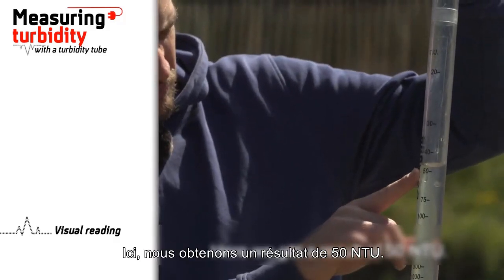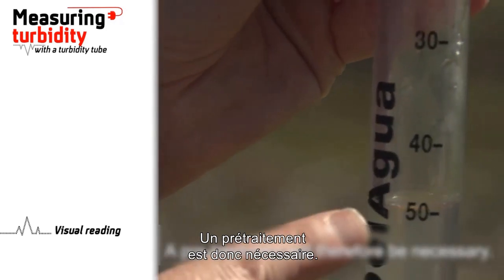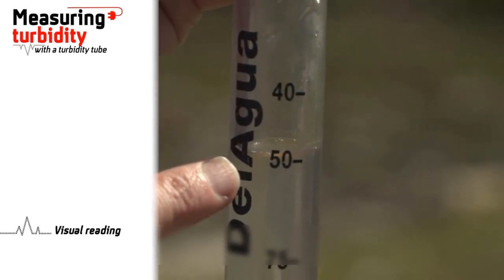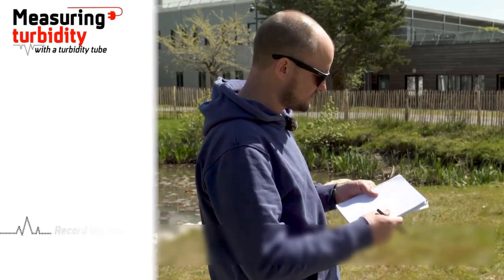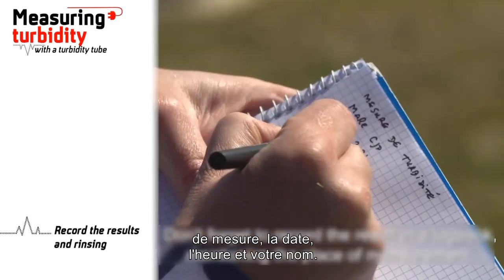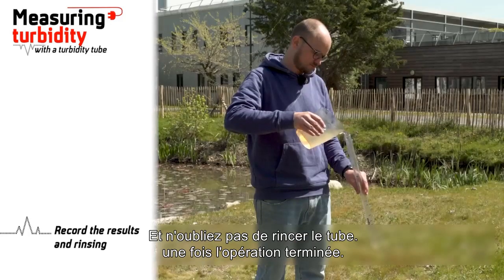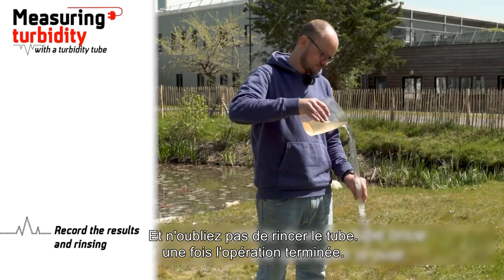Here we get a result of 50 NTU. A pre-treatment will therefore be necessary. Don't forget to record the result in a logbook, mentioning the place of measurement, the date, the time, and your name. And don't forget to rinse the tube once the operation is over.